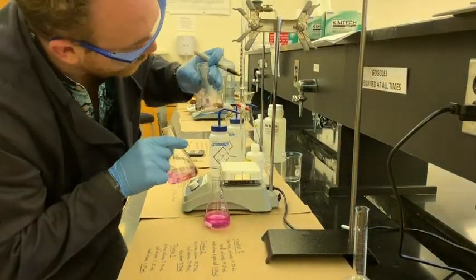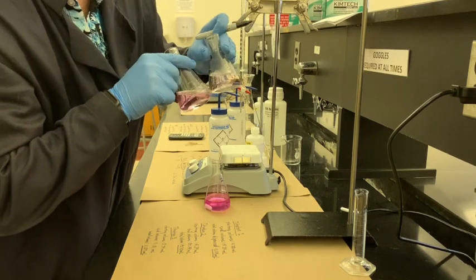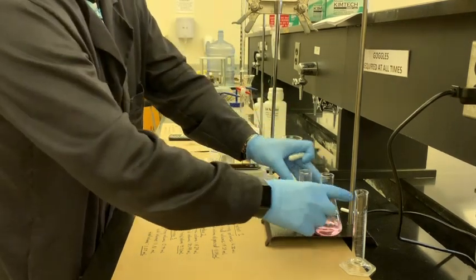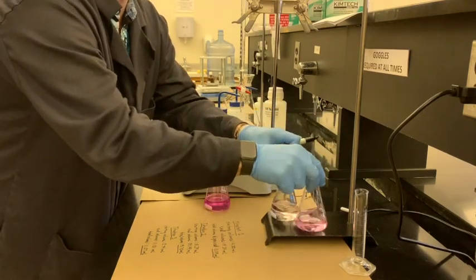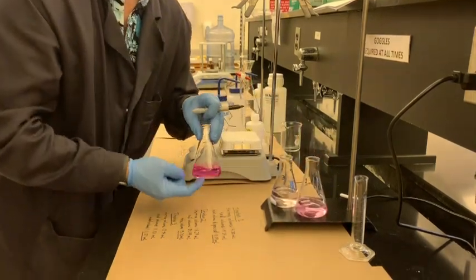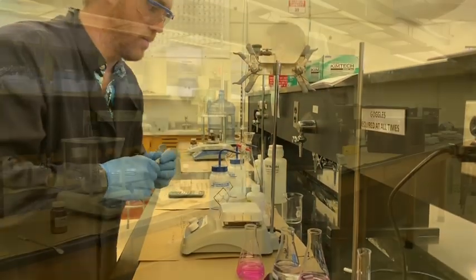it's just very barely pink. Still you can see, even maybe just a little shy of it. They are going to be probably the most accurate results that you should consider highly, versus the more inaccurate result, which is going to be for titration 2. We'll see how the standard deviation works out.